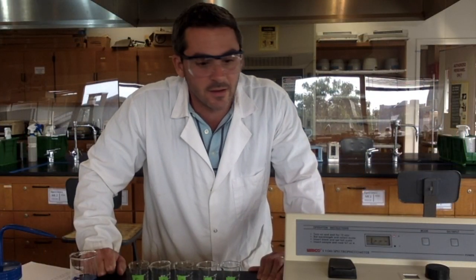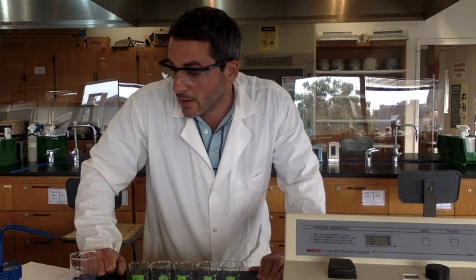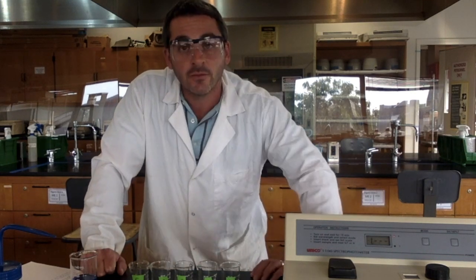All right, guys, we're back. I'm not going to lie, you missed out on a lot of exciting cuvette transferring and absorbance measuring, but I completed the data for my absorbance spectrum to find my analytical wavelength. I'll go over the graphing of that in a different video, but right now we're going to move on to part 2 of this experiment, which is to make a calibration curve.